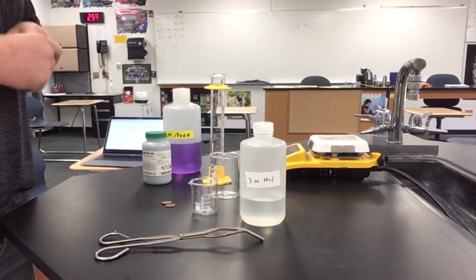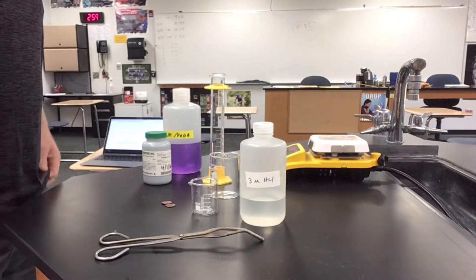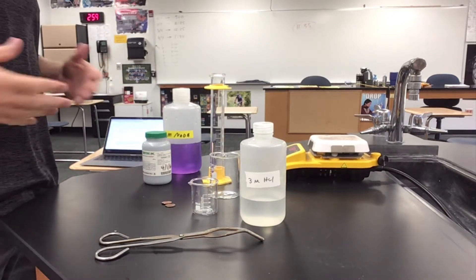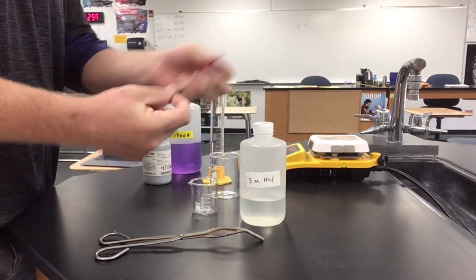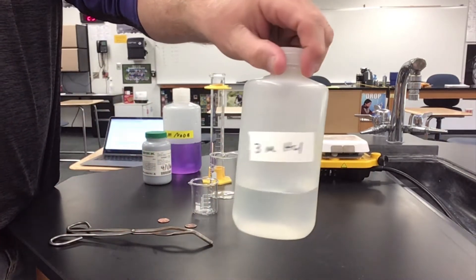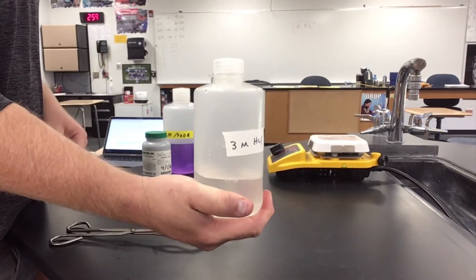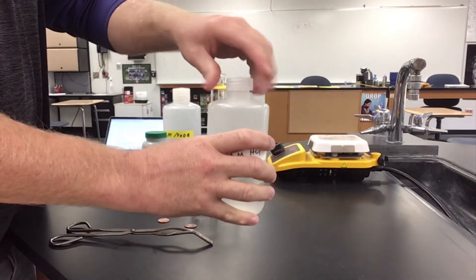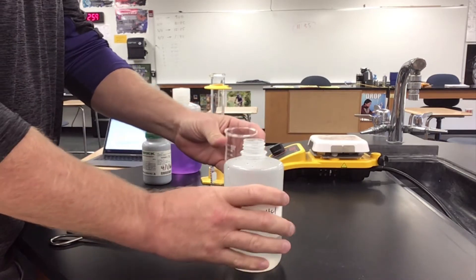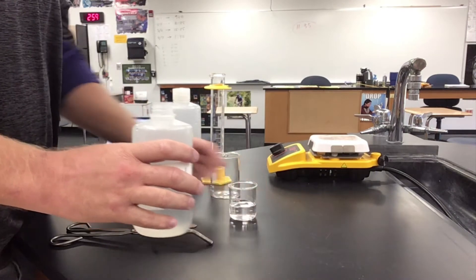In this video we're going to take a look at the penny alloy lab. The procedure is there for you and you can follow along as I do the lab. First thing we need is a penny and three molar hydrochloric acid. The safety concern is that three molar hydrochloric acid is very corrosive to organic tissue including skin and eyes, so we want to be careful not to get that on us — that's why I'm wearing safety protection and glasses today.